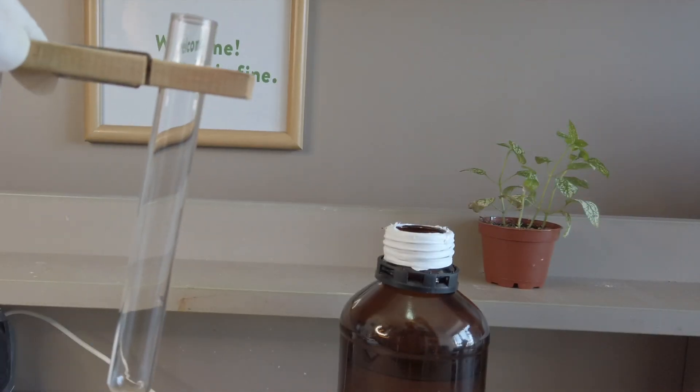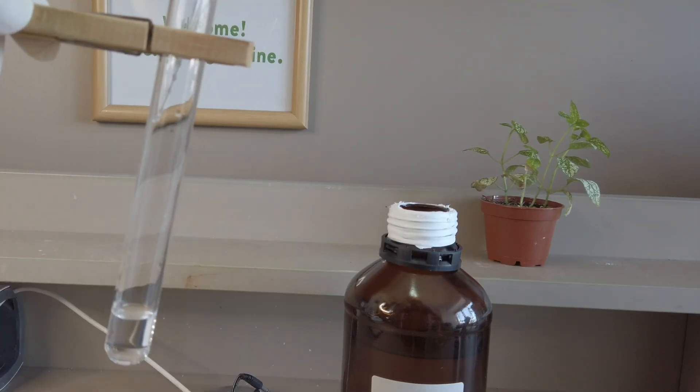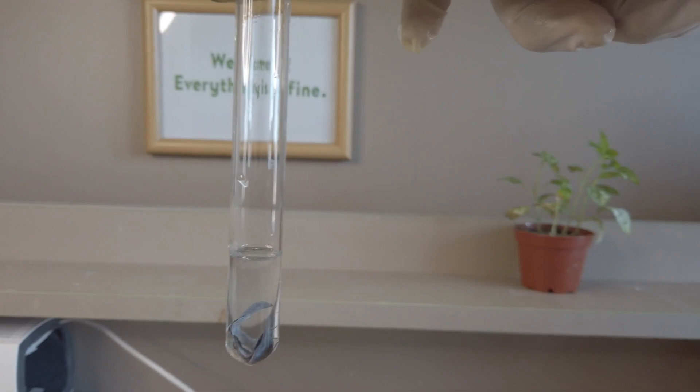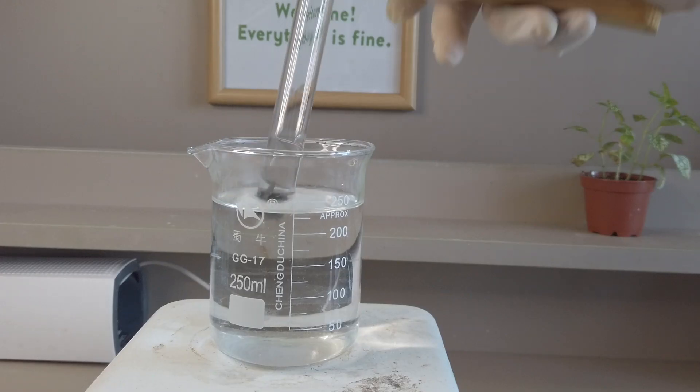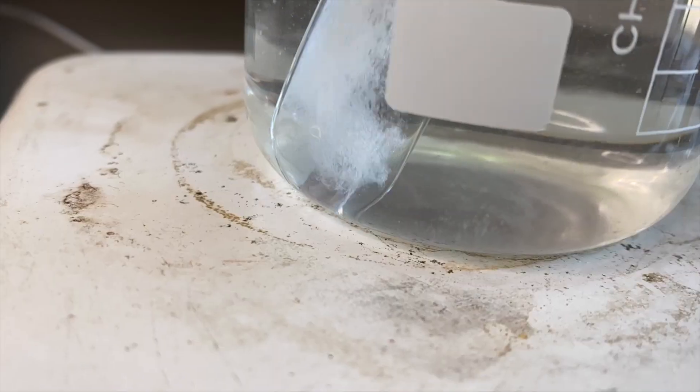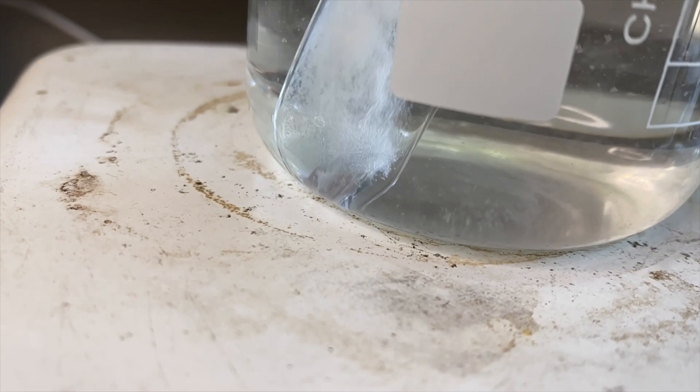Then into a test tube we added some very diluted nitric acid followed by the lead sheets. As you can see, the reaction is quite slow, so we decided to put it in a warm water bath to speed things up. Immediately, a lot of bubbles emerge from the sheet.